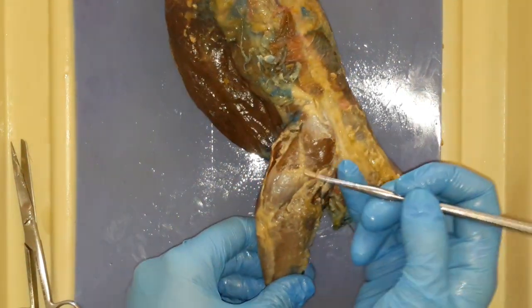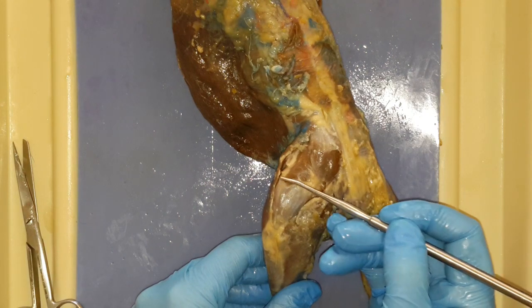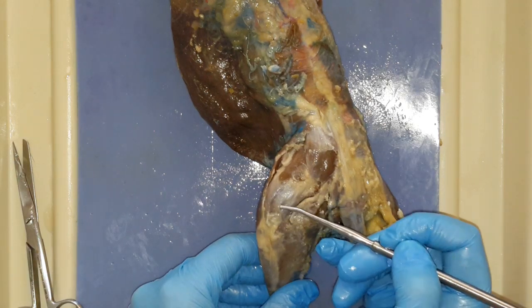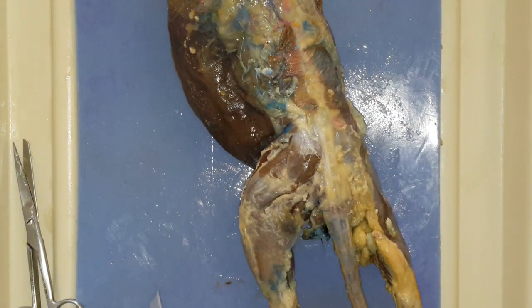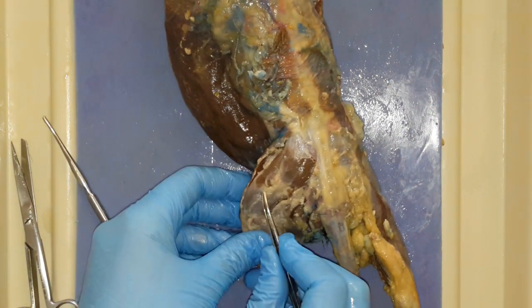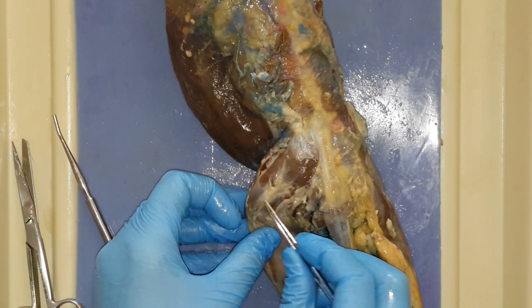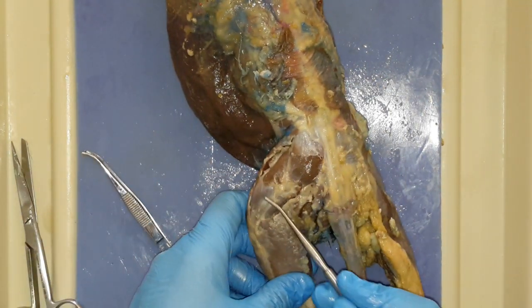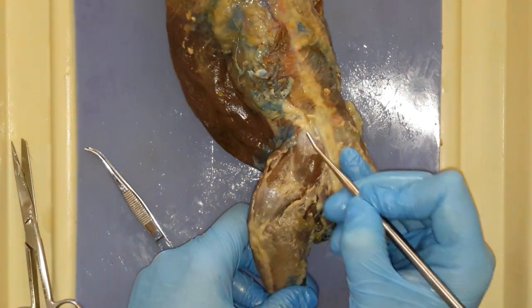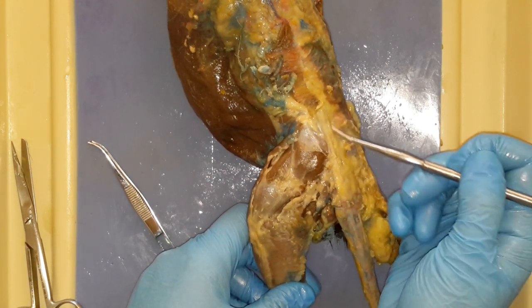And then you have this little muscle right here, and it's connected to this sheath of connective tissue. This muscle is attached to this sheath, which is why I wanted to use this one, because it still has it. That's your tensor fascia latae, or latte — I like this because I like coffee. So the tensor fascia latae is attached to this nice thick sheath. Keep it intact if you haven't. Then we have this kind of larger muscle right near the back, right near the spine.